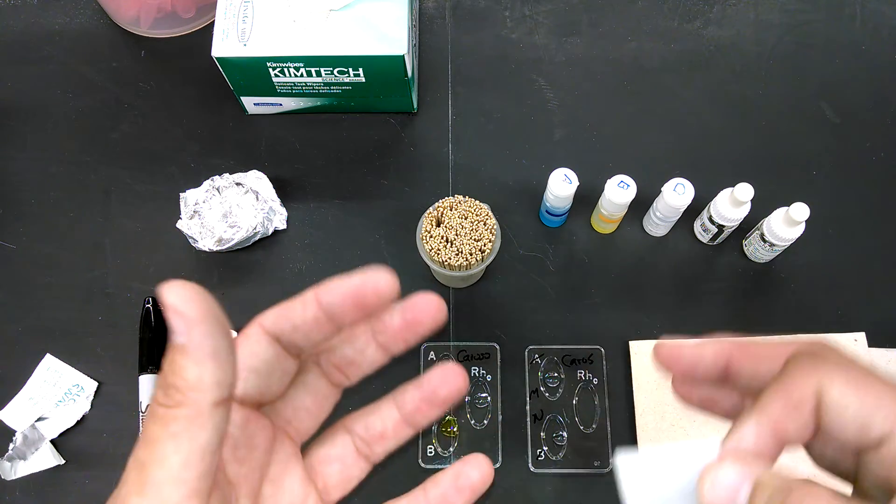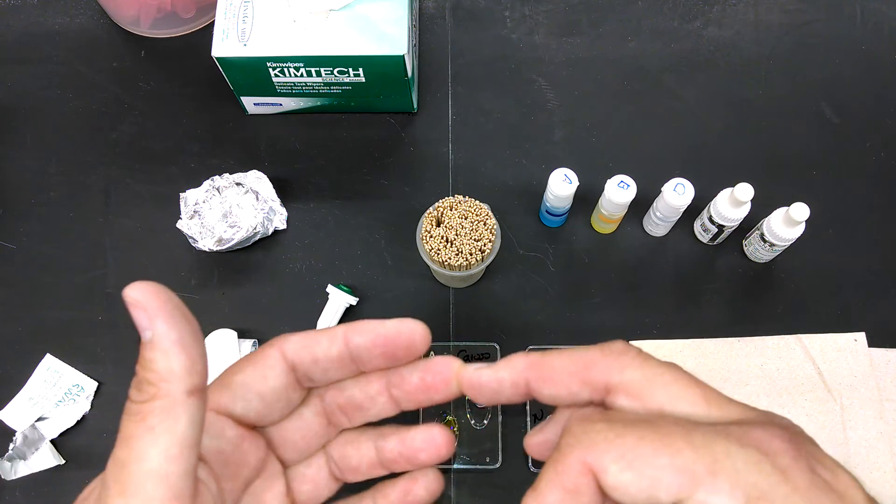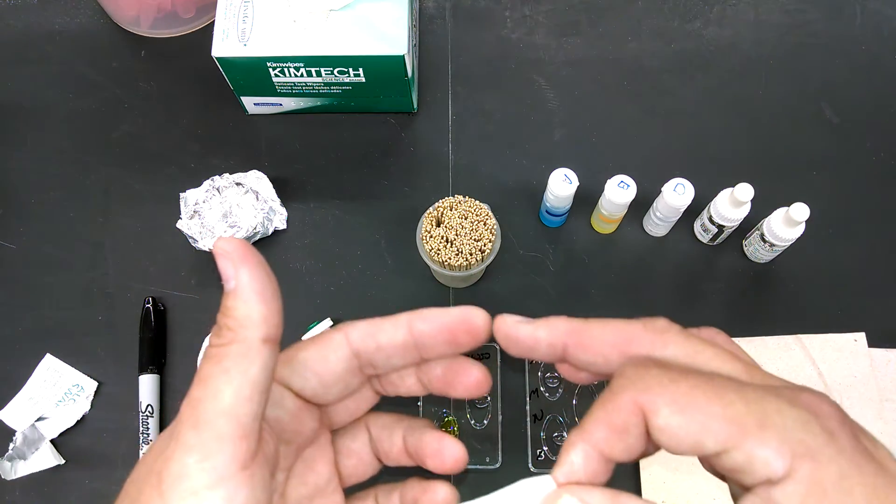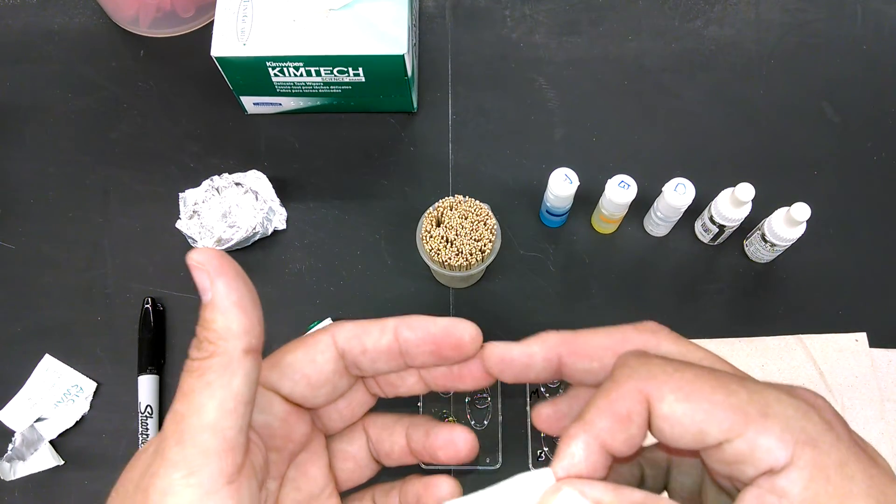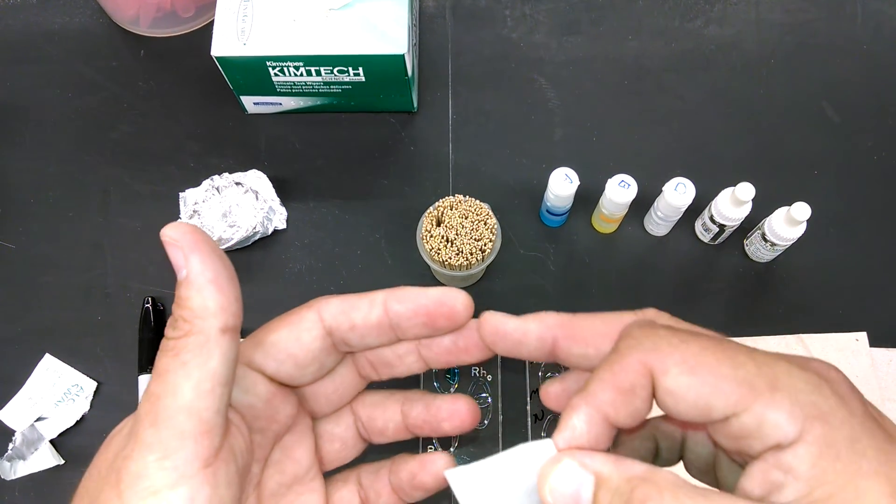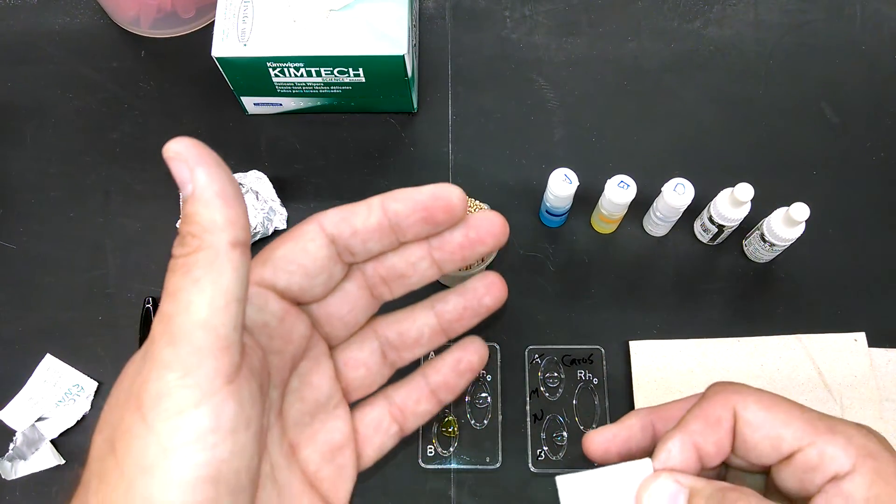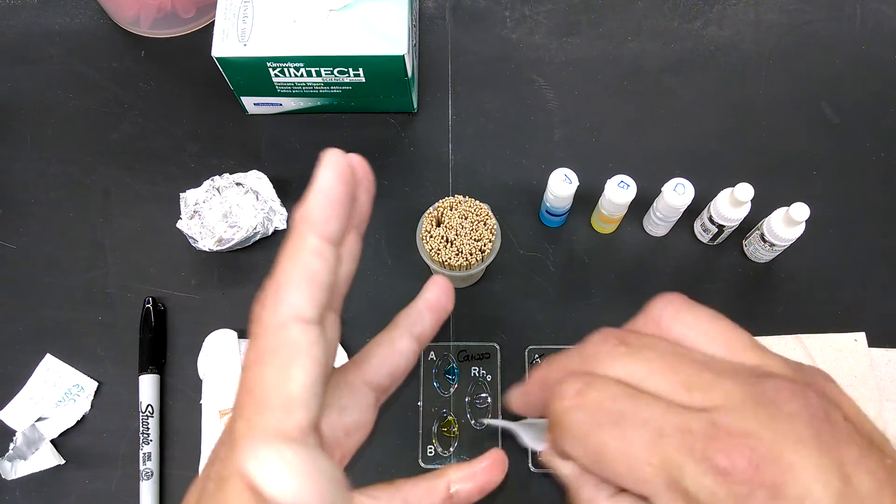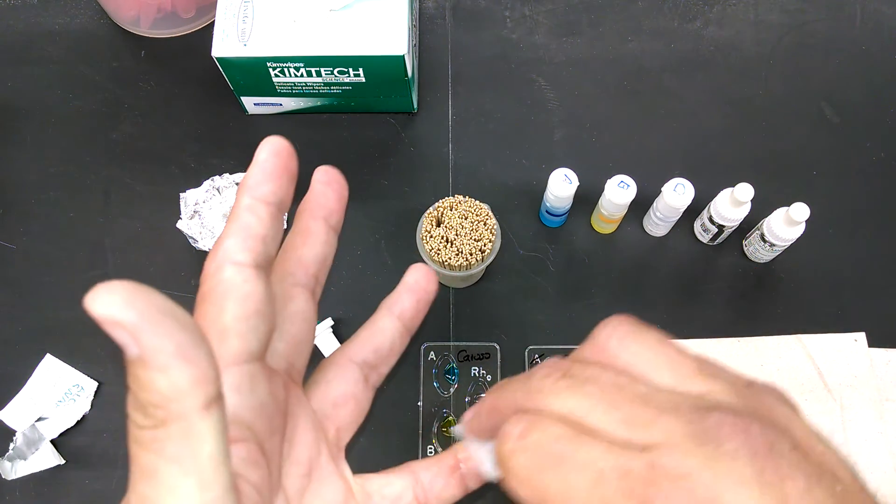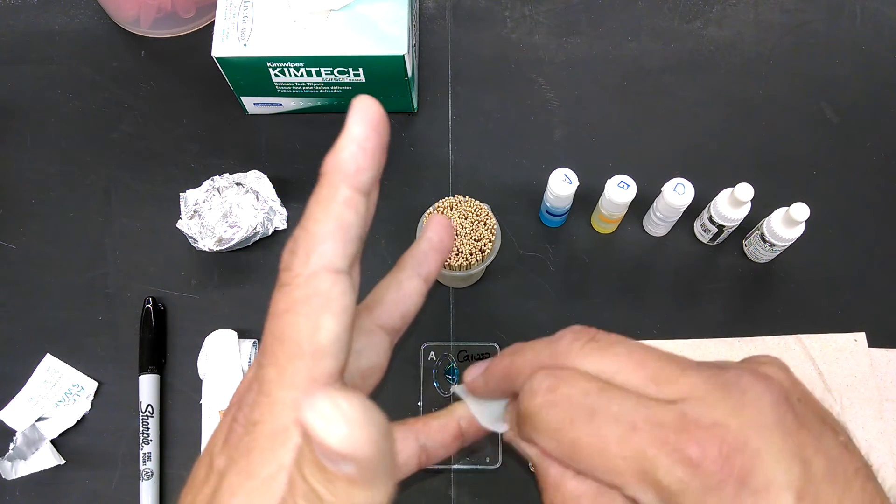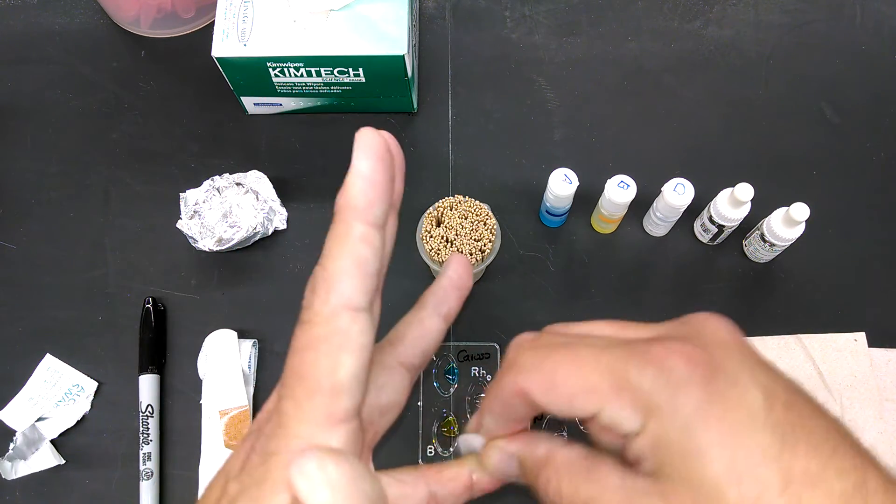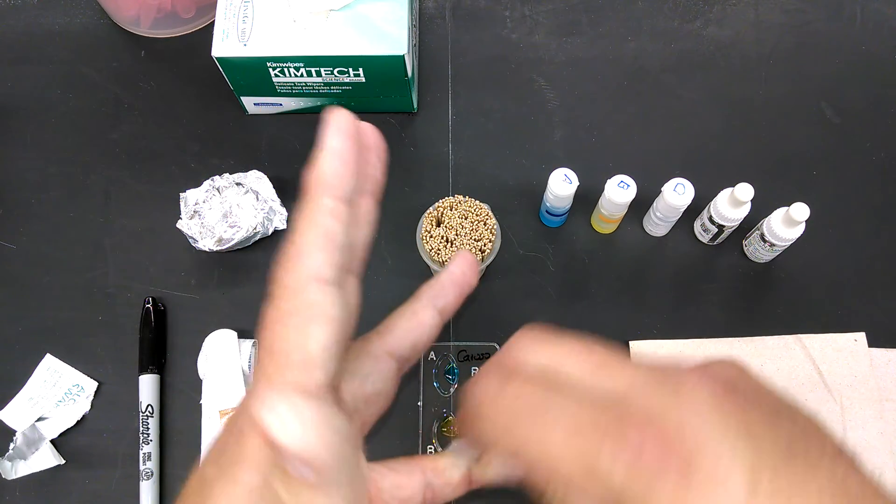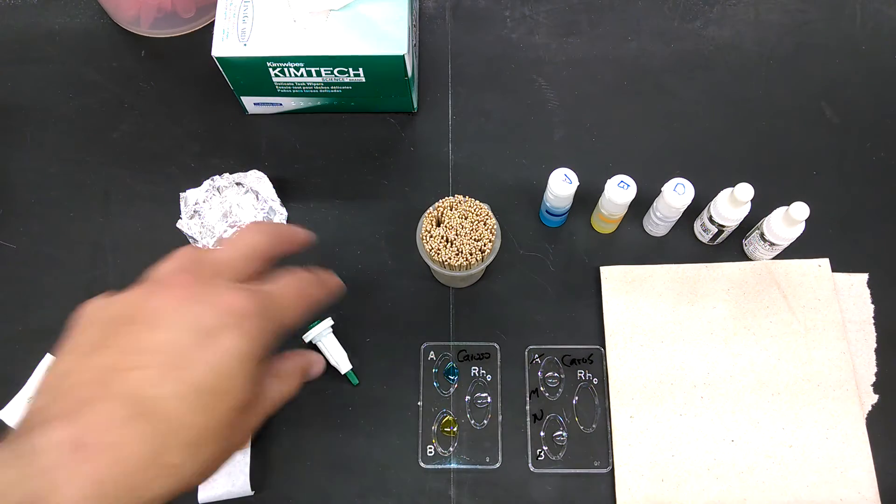It's not that you're going to be bleeding all over the place. It's actually really tough to get blood for a lot of people because this is a very small needle. You don't want to have to do this over and over again. Many of you have big calluses right here. Not to mention this is where all your nerves are. So what I do is I use the side of my pinky right here. Not very many nerves here. And it's thinner skin, so easier to get a little bit of blood. Wipe it down with the alcohol. Kill whatever you can with alcohol. And then let it dry off.